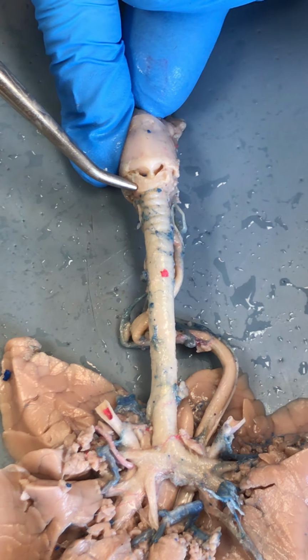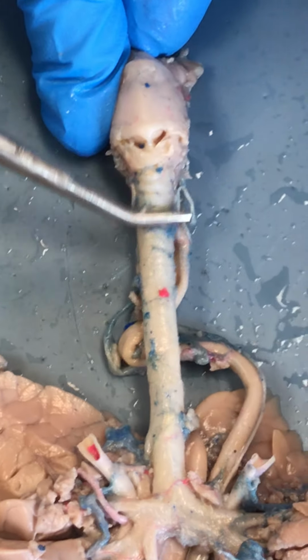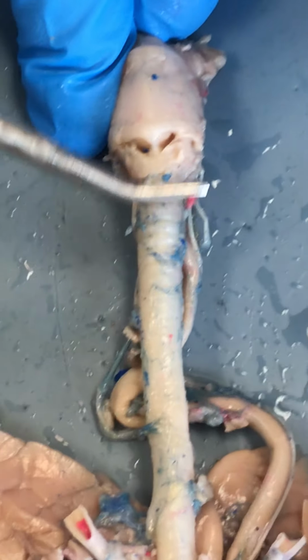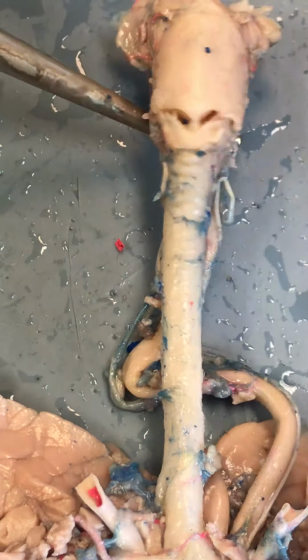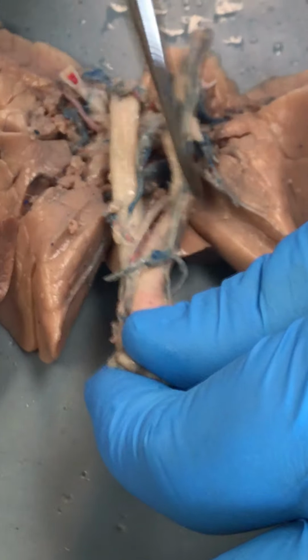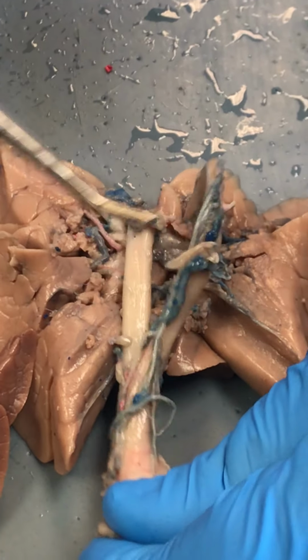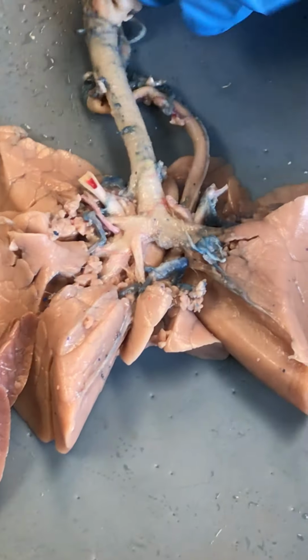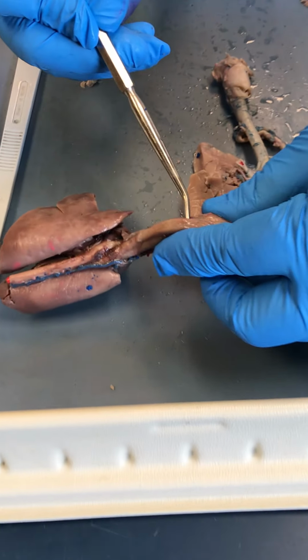Now the cricoid cartilage connects to the trachea, and the trachea has C-shaped rings of hyaline cartilage. And when we look at the trachea, if we flip it over and we look at the back here, we see that the esophagus was directly attached to the back. And to better represent that, I'm going to take a look here at this other dissection, and we're just going to together pull that apart.